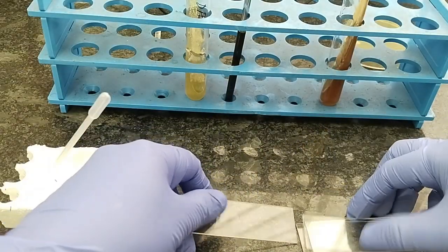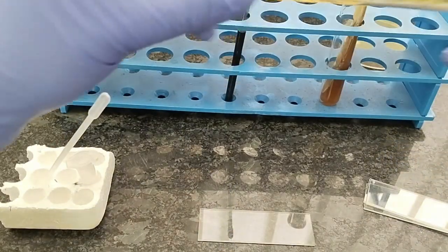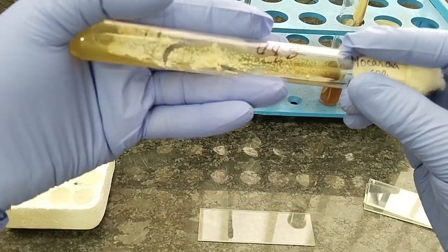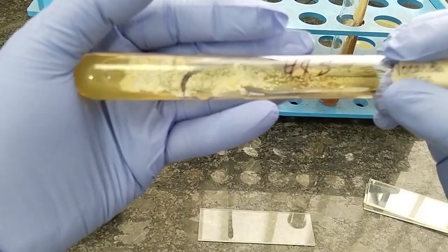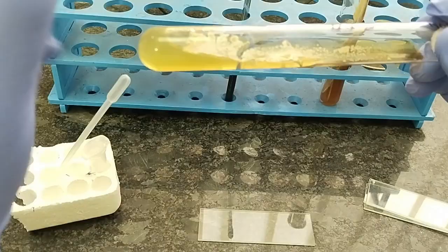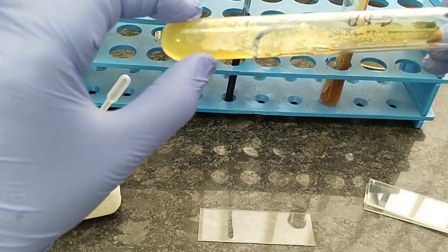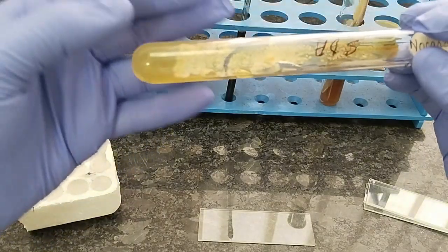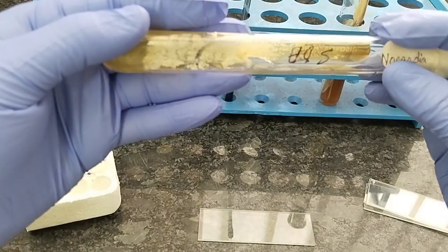make a smear of Nocardia. First of all, this type of colony is very difficult to emulsify. This is the white type colony, white or maybe with pigmentation produced, and it is very important for the demonstration purpose. There are various species of Nocardia. Maximum are pathogenic bacteria, and some are non-pathogenic bacteria.